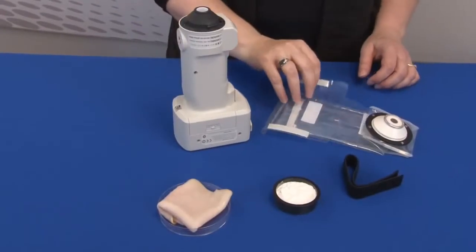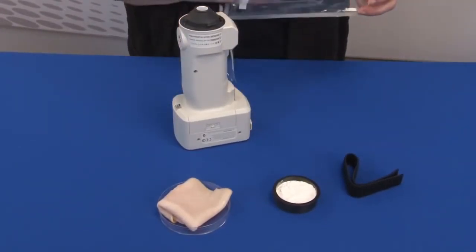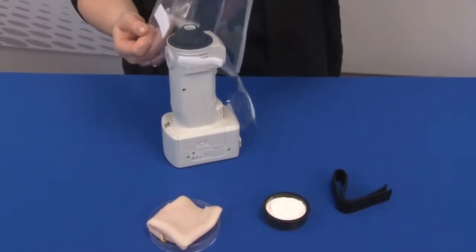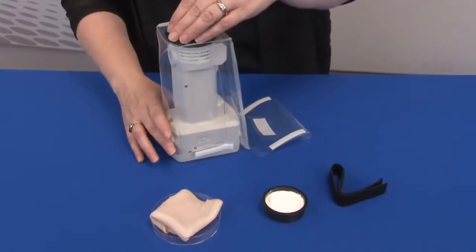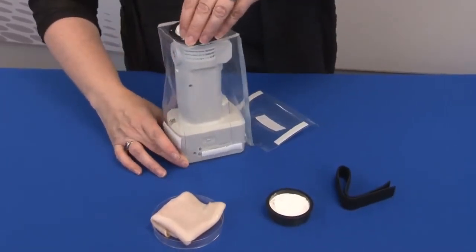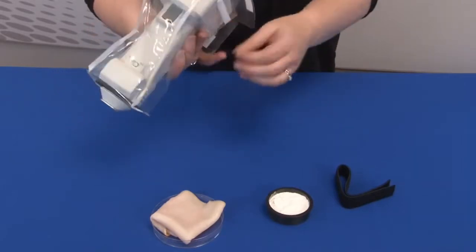For dusty environments, a dust cover is an important accessory to have for your instrument. This accessory is ideal for dusty environments as well as for measuring paste, powders, or wet surfaces. Let's take a look at how a dust cover is easily and securely fastened around an instrument.